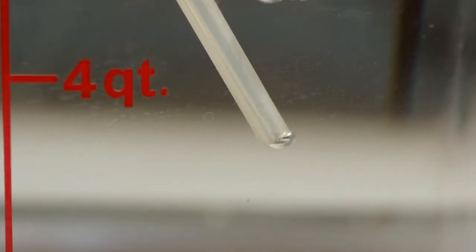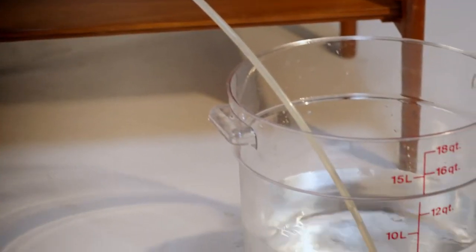Slowly increase regulator pressure towards the designated bubble point for your specific filter brand and porosity. During this time, you may see a small stream of bubbles. This may be gas diffusing through the liquid membrane on the filter and not be a true sign of bubble point.